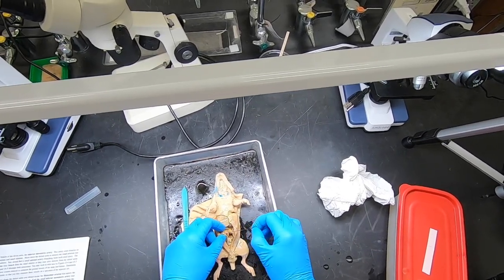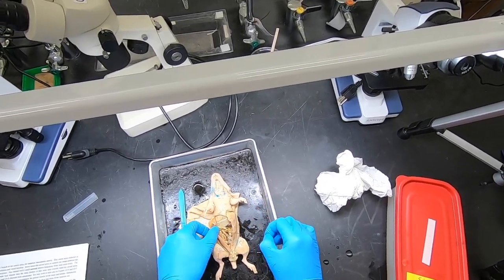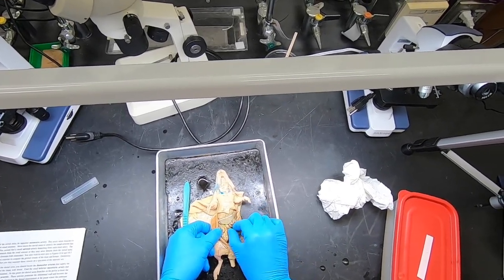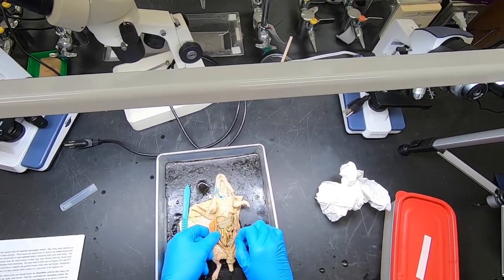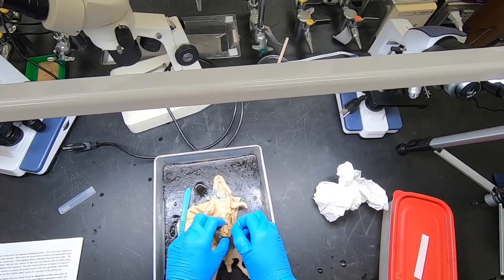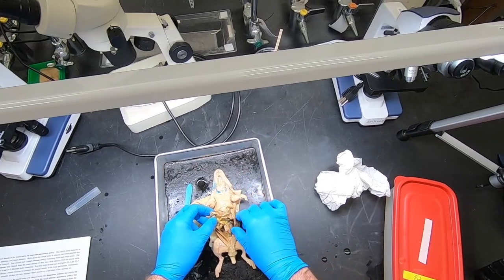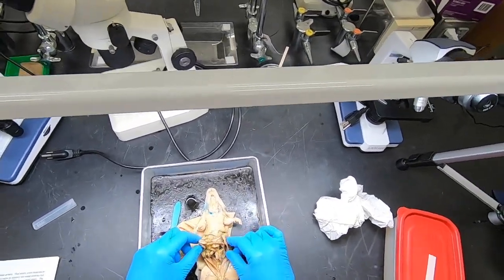There's some strain here, probably from the preparation. Oh my goodness, all of her guts are coming out—that's probably having to do with the dye injection process.